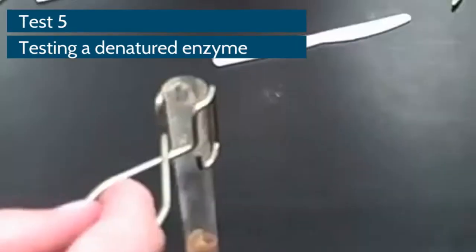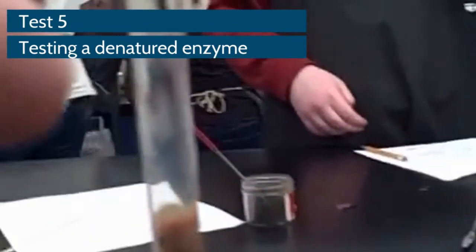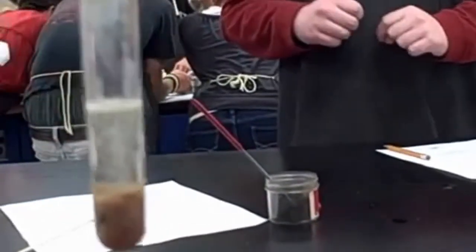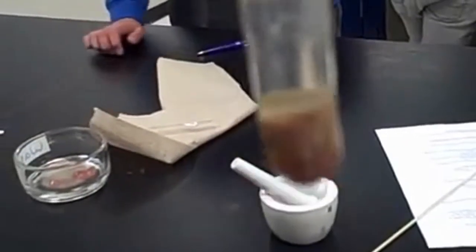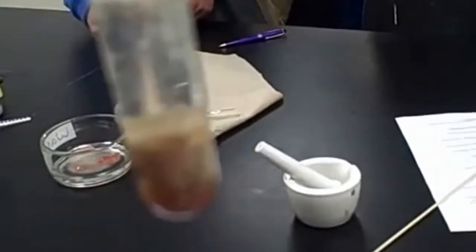What's for dinner? Looks like chicken liver. Okay, Simone, go ahead and add hydrogen peroxide into the test tube here with our cooked liver. That's a good volume right there. Okay, and Andrew, maybe you could just lift this up a little bit higher so I can see it. Okay, what do you guys notice happening in this test tube? It's kind of bubbling, but not really that much. Yeah, it's bubbling a little bit. Bubbling a little bit? Okay, is it as much as what we saw before? No. Okay, definitely I would say that I agree with you. It's not nearly the level of bubbles that we saw with the other tests.